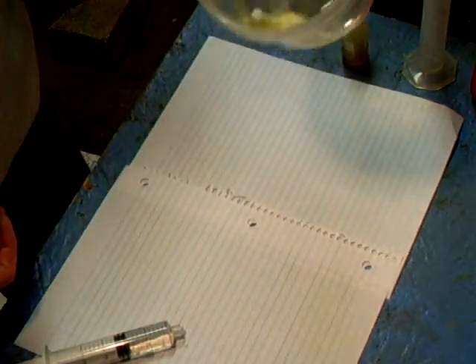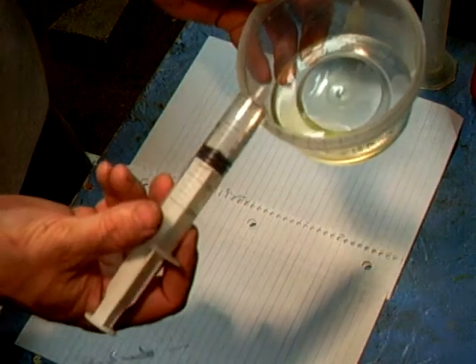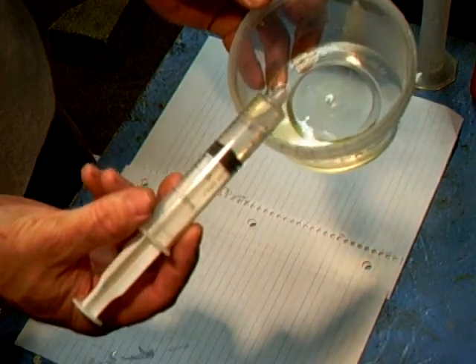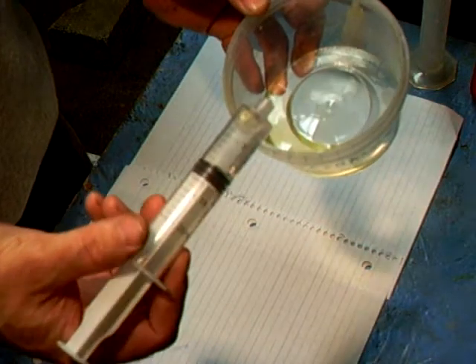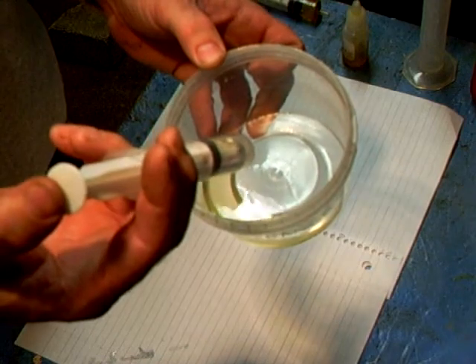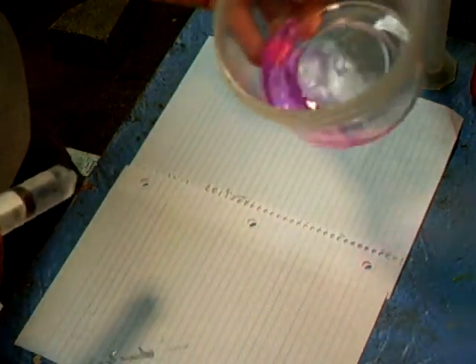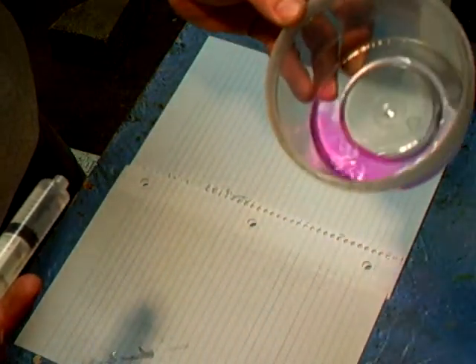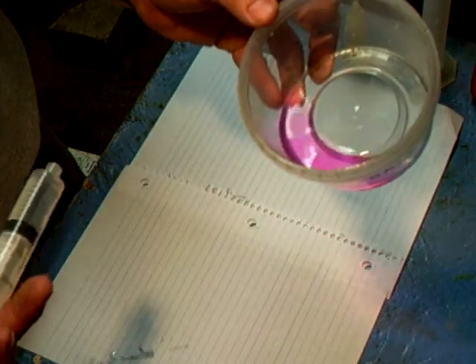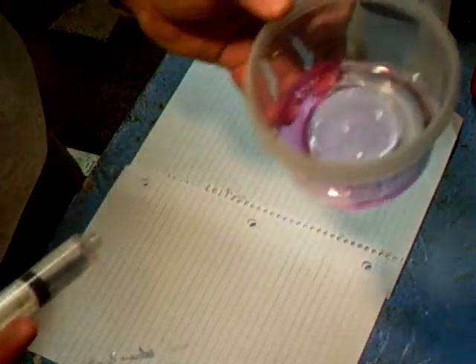Now, if you can tell, there is a little difference in color, but it's not a big deal. I've already added about 10 milliliters of reference solution to the syringe. We're going to add a drop — yeah, that's two drops — a couple few drops into the alcohol and phenol red, and now the alcohol is neutralized for any acid that's in it. It's kind of purplish in color.